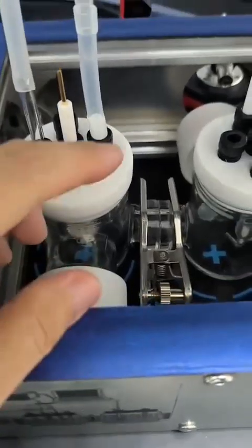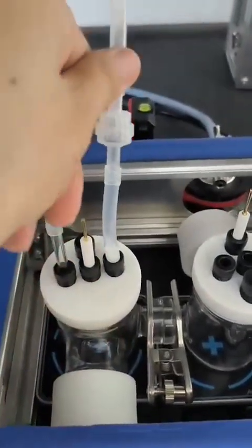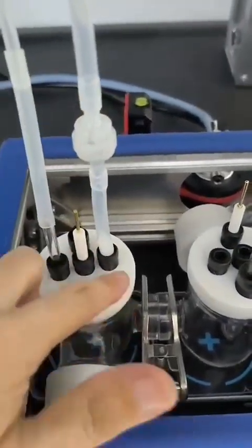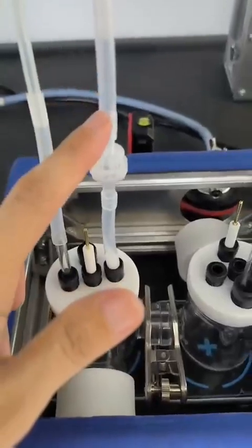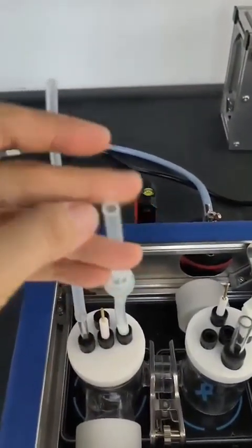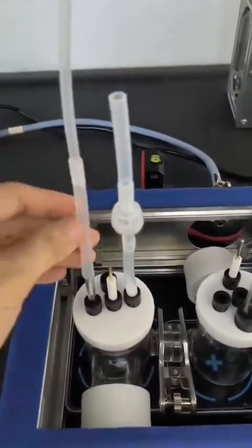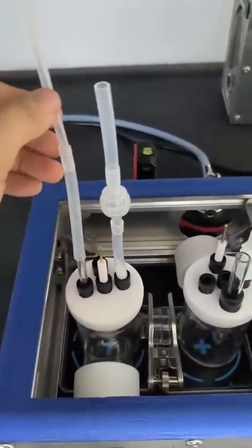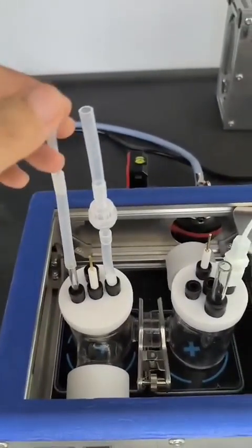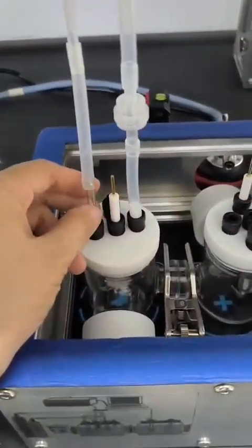You can put it here. And this is a single-way valve. Pay attention to the direction of the single-way valve. Make sure the gas flows in from here and out from here. You can collect your gas sample from this side, as in our training. And this is the demo for how to collect a liquid sample. You can use the same thing and suck your liquid from the top of the tube and keep it in the liquid storage.